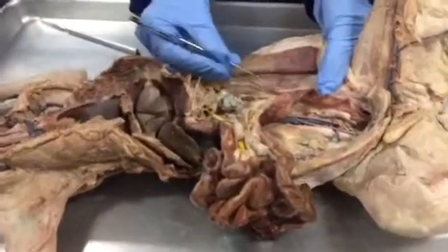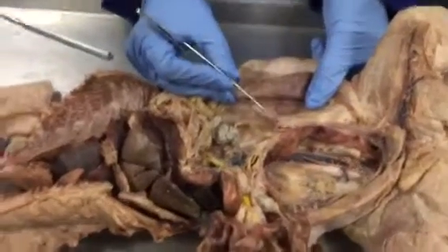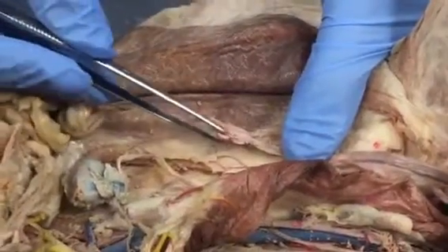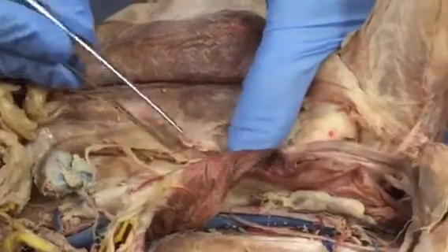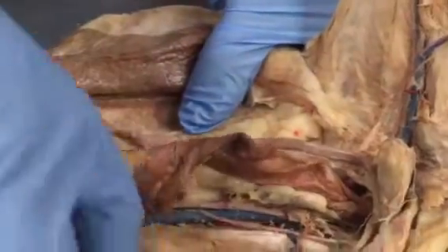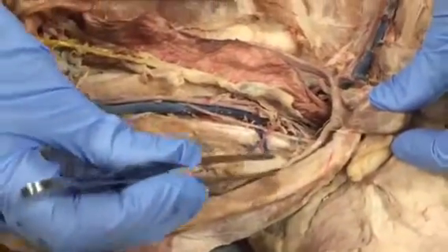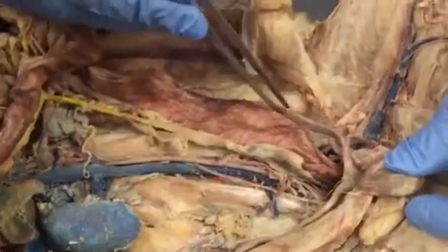Now, ovaries are very small because they are almond-sized in humans. So see here, these are the ovaries, so small. These ones, these are the ovaries. This is the uterine horn, and the uterine horn is on both sides. So here, this is a uterine horn too. This is a uterine horn, and this is the uterine horn.